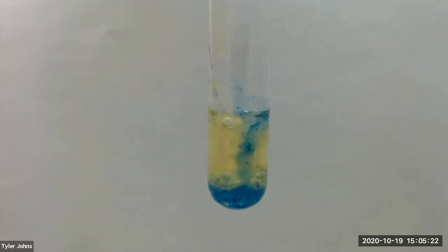The blue flocculant confirms the presence of magnesium ion.